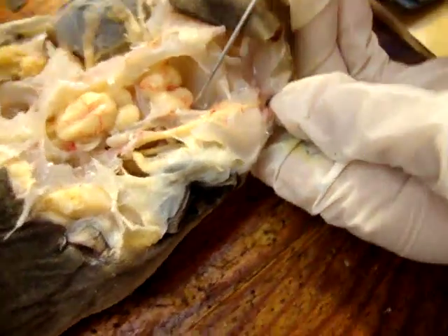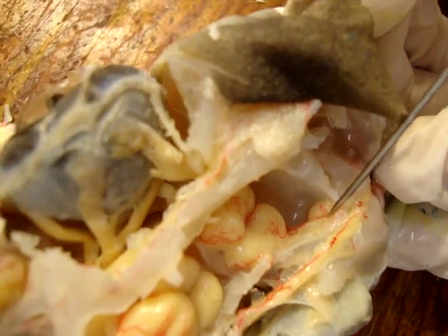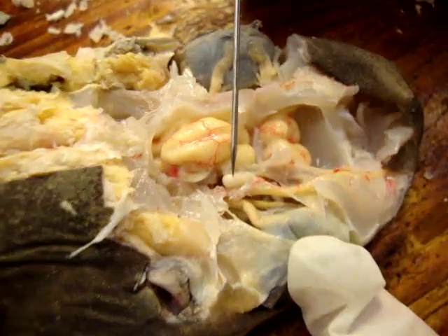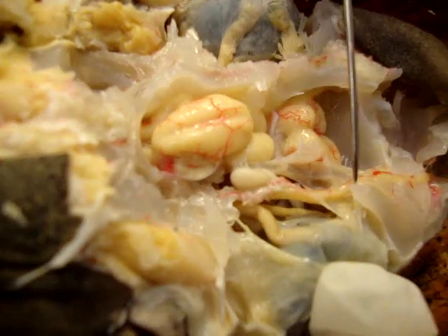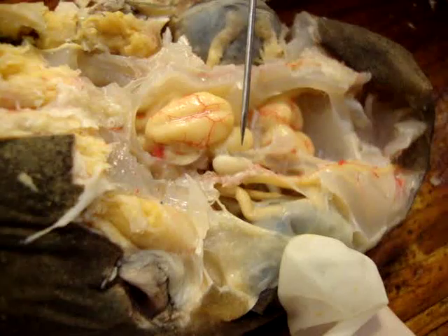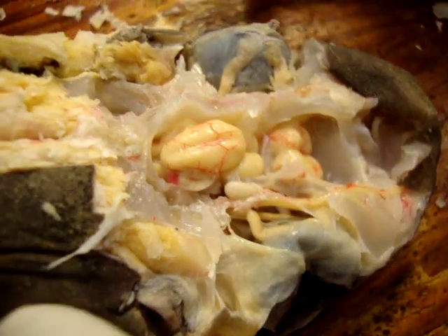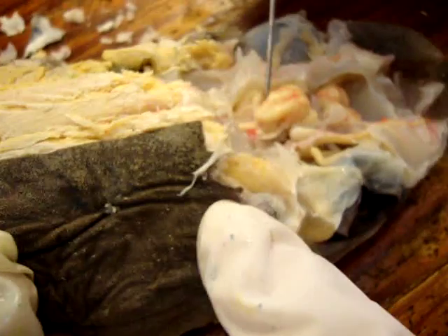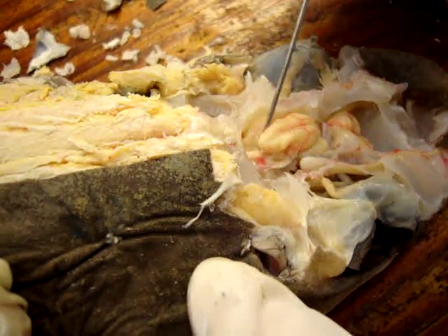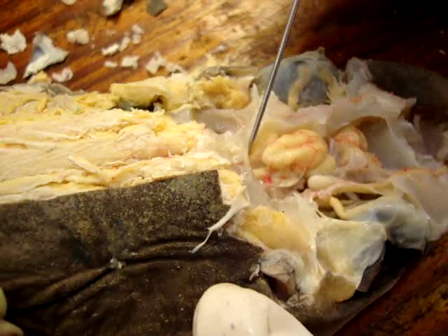This coming off of the olfactory lobes is the olfactory stalk. This one running down along here is the trigeminal and facial. Then up here is the medulla oblongata, which then connects to the spinal cord.